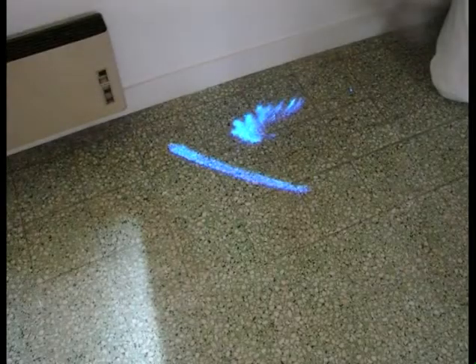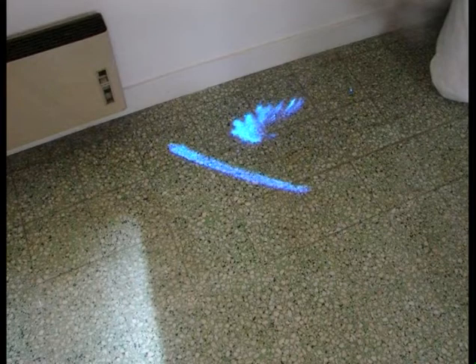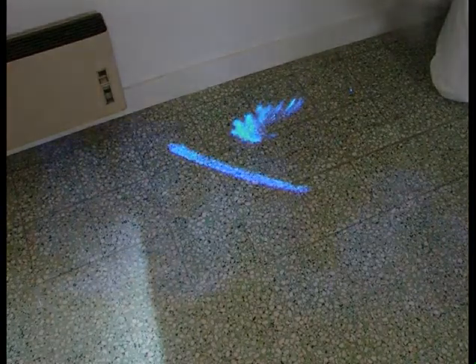The blood stains were not visible, which is why we are using this product. But the value of proceeding as we have done is that we can see they have a specific shape, which will certainly be useful for the person doing the blood stain pattern analysis afterwards. The shape of the blood stains will certainly tell us what was used to clean the scene — if it was a sponge, we can determine its characteristics.